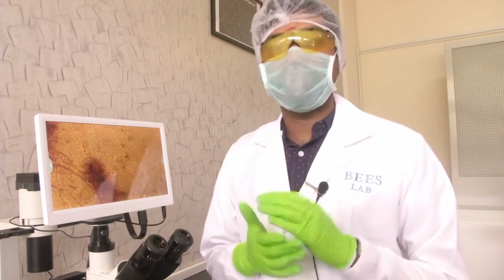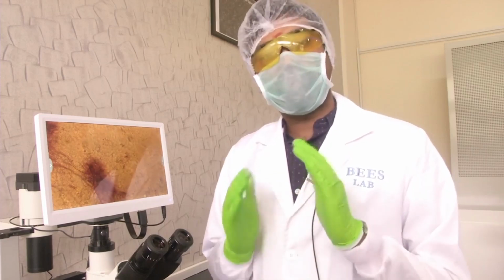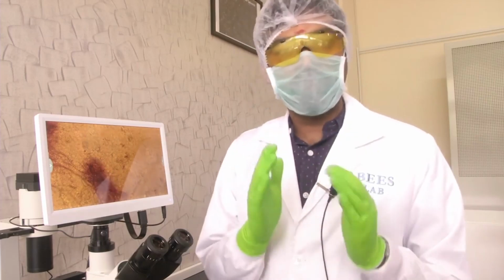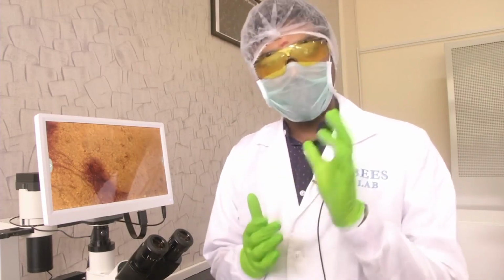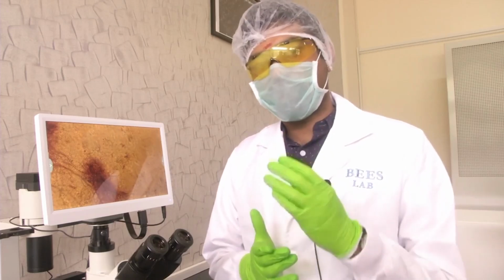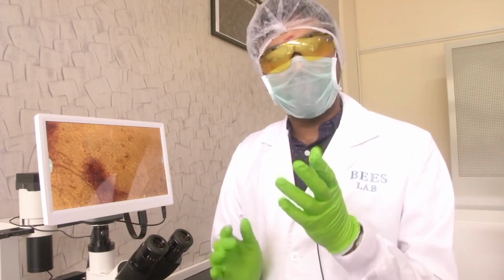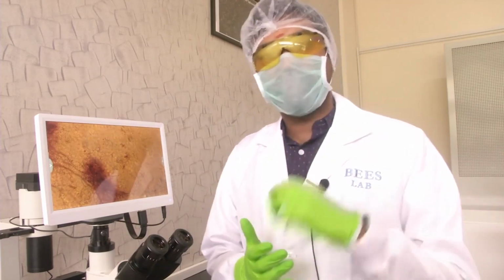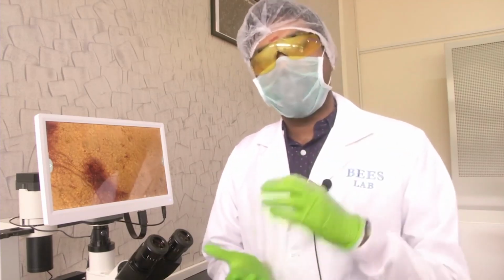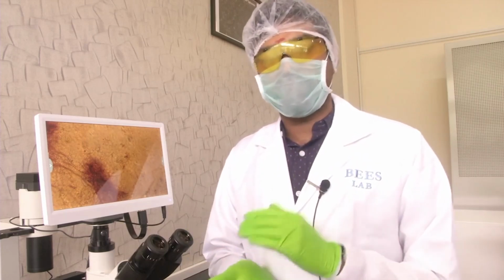The name suggests it is called inverted microscope. Why is it inverted? Let me recap. The main components of a microscope are the eyepiece through which we see the sample, the objective lens arrangement, which actually captures the image and collects the light from the sample, either the transmitted light or the reflected light, and you have the sample holder stage where you keep the sample.